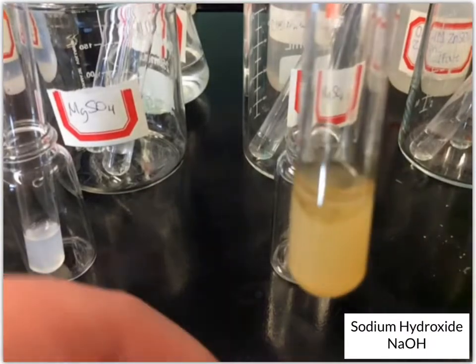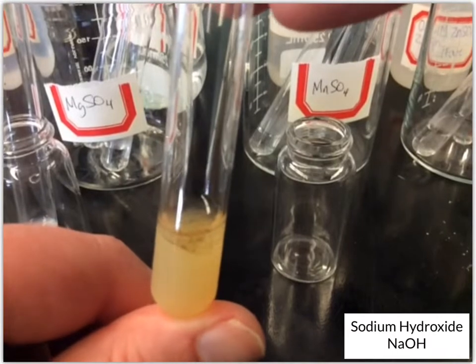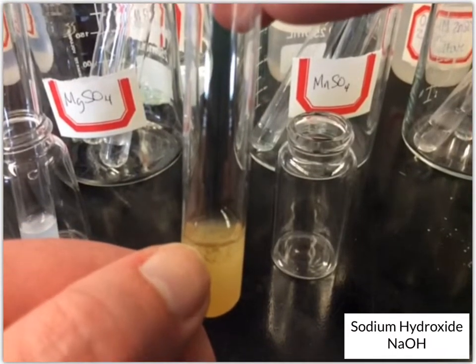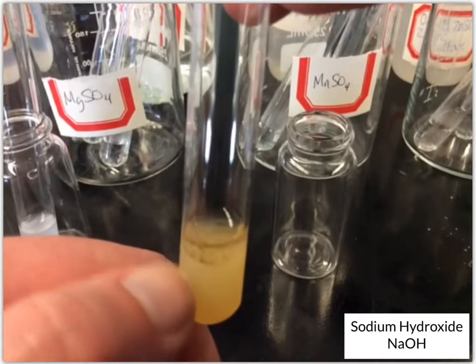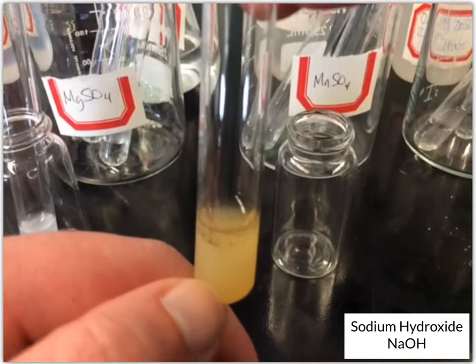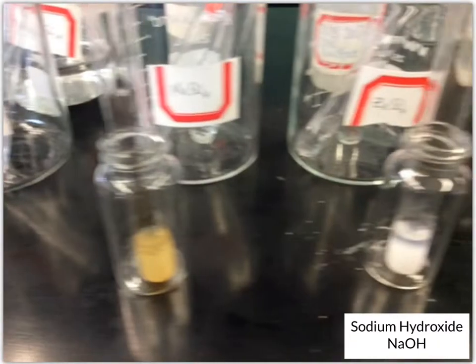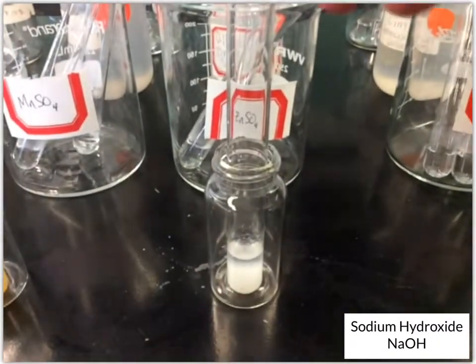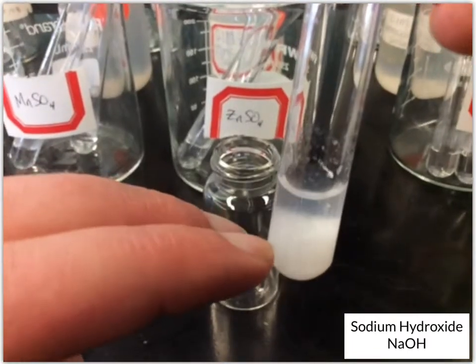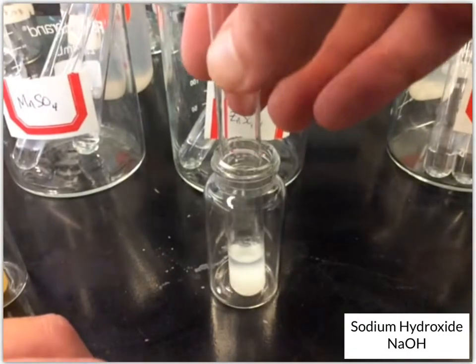Okay, and then the manganese(II) sulfate. Looks like it's started to separate a little bit, but you've even got some dark brown solid that's floating around in there, along with still that yellowish solution that you can't see through. Okay, and then the zinc sulfate, that one has started to settle, so you've got kind of that clear solution at the top and a lot of white solid down at the bottom.